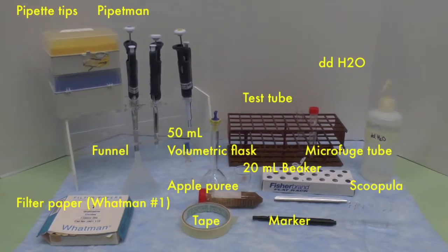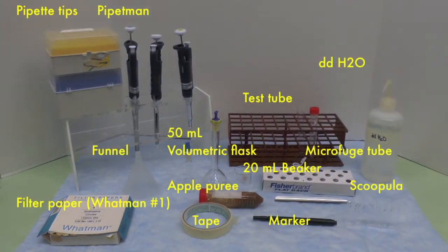This video will demonstrate how to perform carbohydrate analysis using enzymatic method. Here is the equipment you will need.